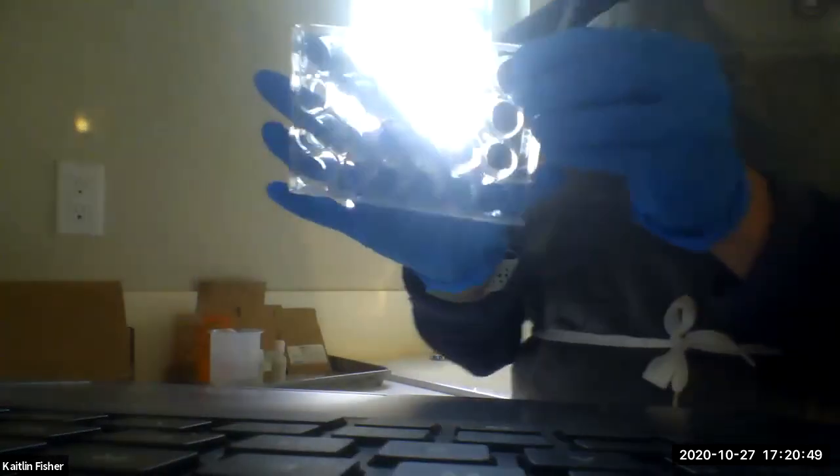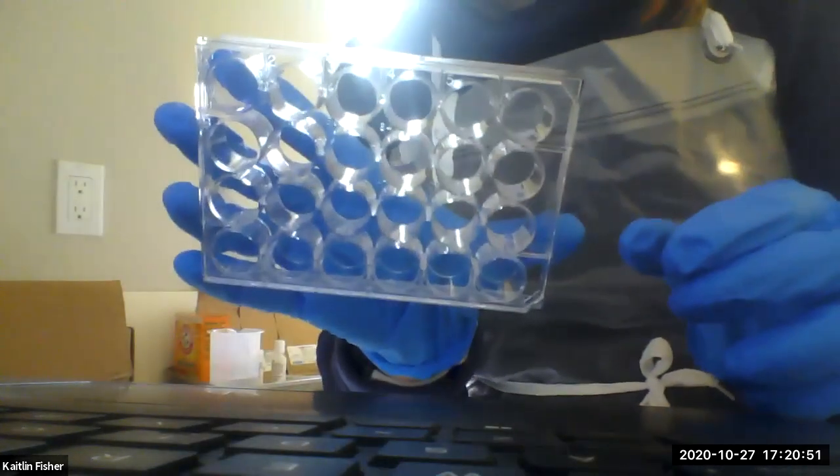Okay, so the last thing that I want to talk about, or last 2 things, is number 1, what would be a good way to set up your well plate? As I mentioned before, when you have your well plate like this, if you look on the actual well plate itself, and it's kind of hard for me to capture on this camera for the doc cam, in clear plastic, it's actually labeled.